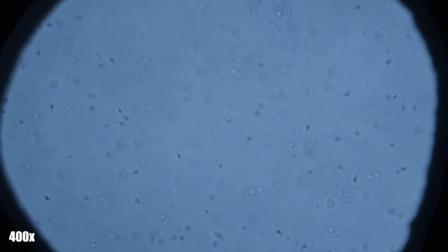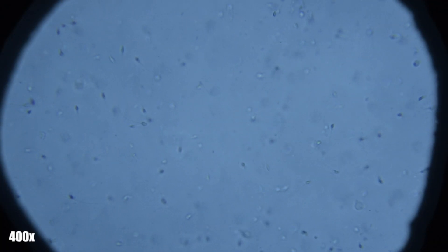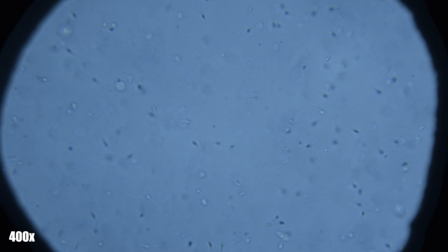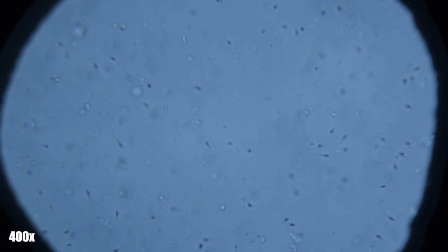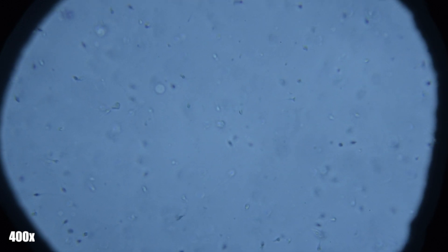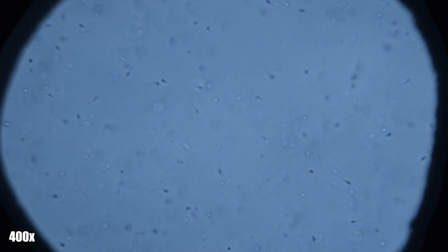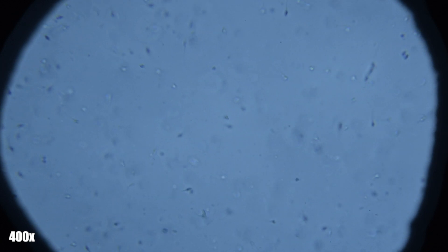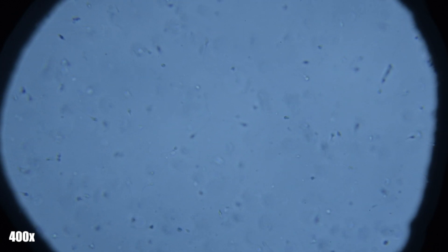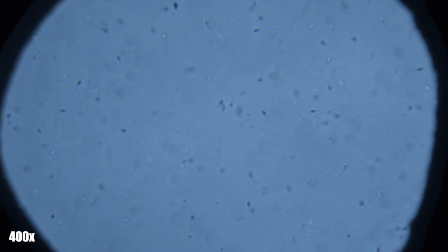Here are my would-be progeny in all of their glory — pretty strong swimmers if I would say so myself. I've added some stain to the sample to make it easier to see. These images that you're seeing now are at 400 times magnification and I'll have some 1000 times magnification here soon.